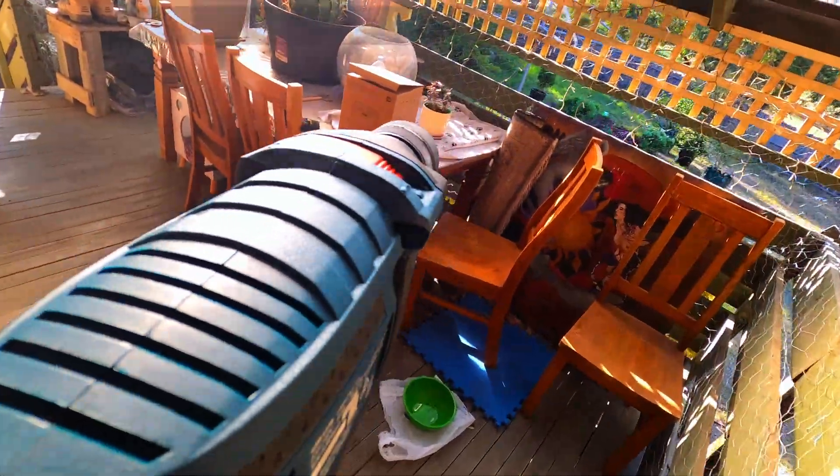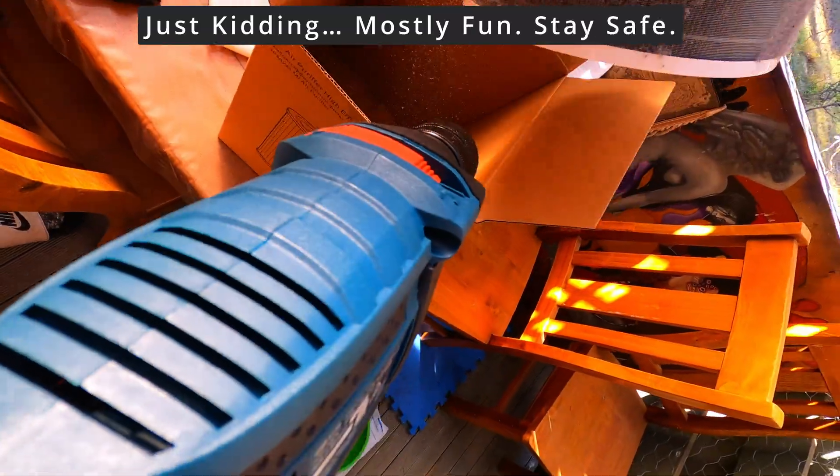Yes, I attached a GoPro to a power drill. Because science should be dangerous and fun. Time to extract a sample like a maniacal scientist.